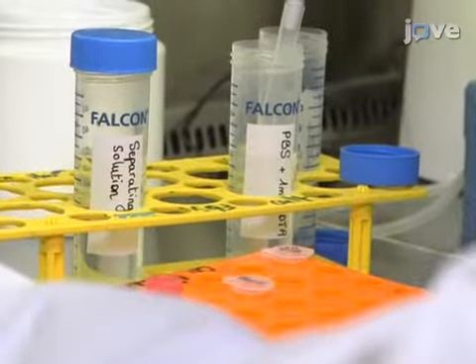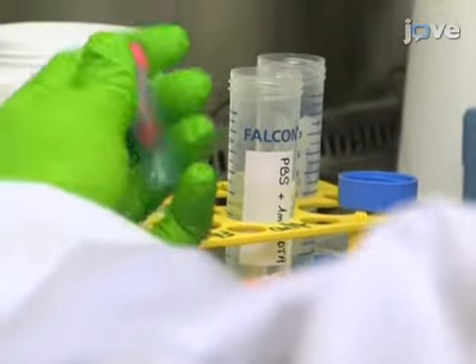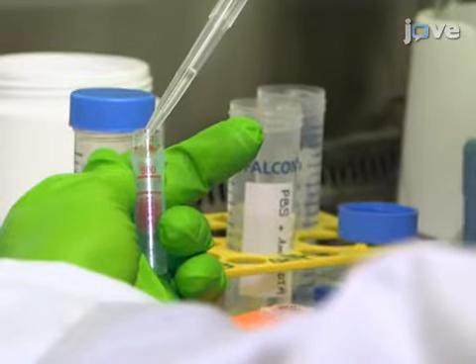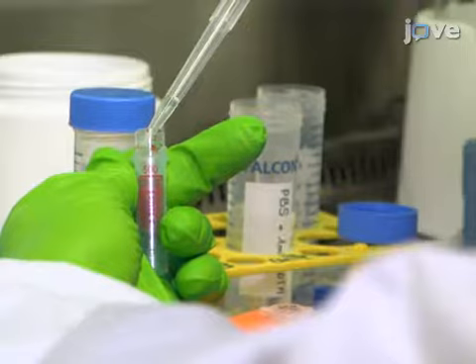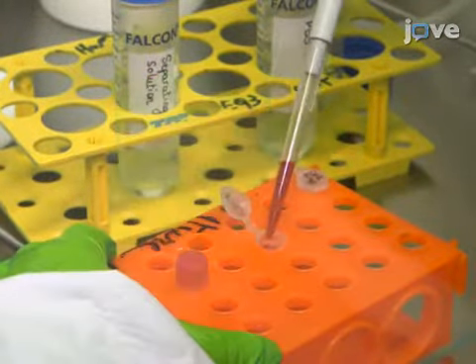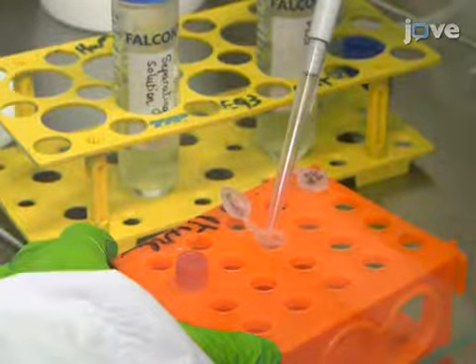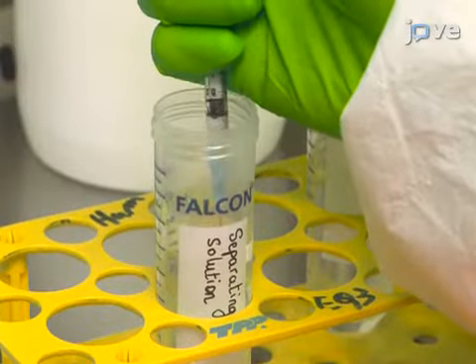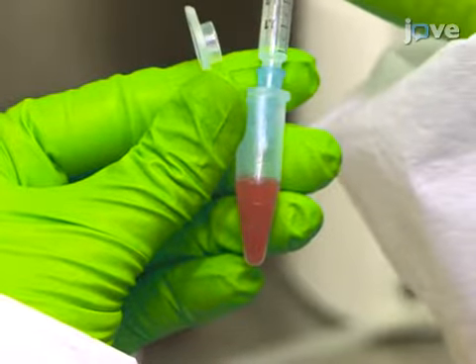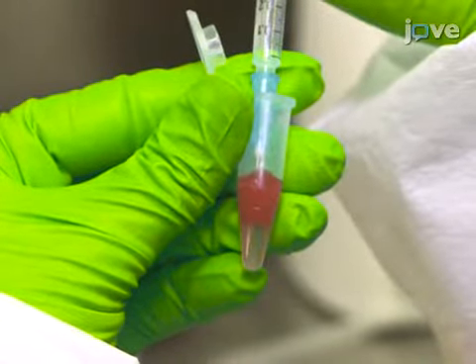To isolate the blood mononuclear cells, first add PBS supplemented with 1 millimolar EDTA up to a final volume of 500 microliters. Then, transfer the sample to a microcentrifuge tube. Next, use a 1 ml syringe equipped with a 30 gauge needle to carefully layer 500 microliters of separating solution under the blood, taking care not to mix the layers.